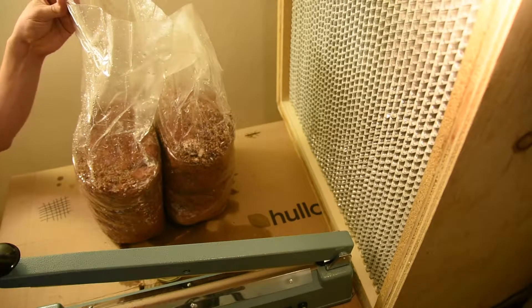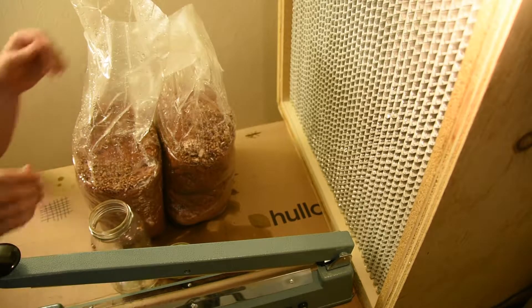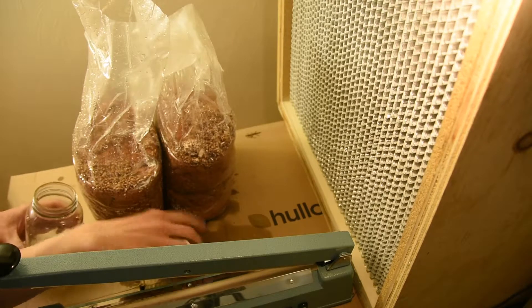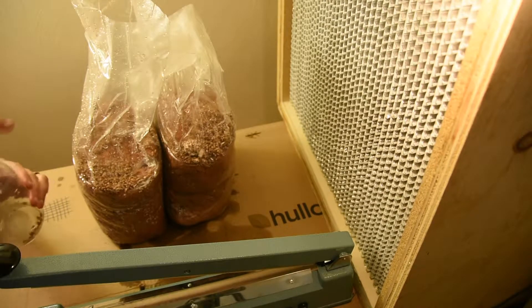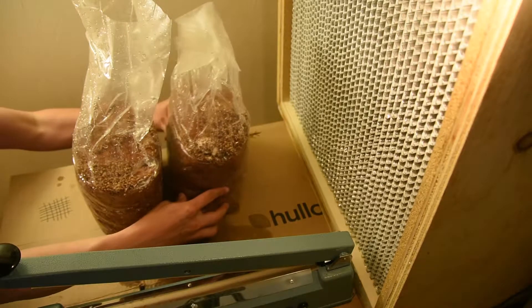I'm not shaking, not dumping, not smacking. I made sure that I loosened up all the grain before I got started because that can be a problem. You don't want to be stirring up air by shaking the jar while you're working with bags open.